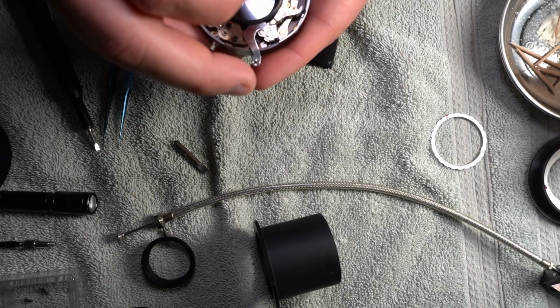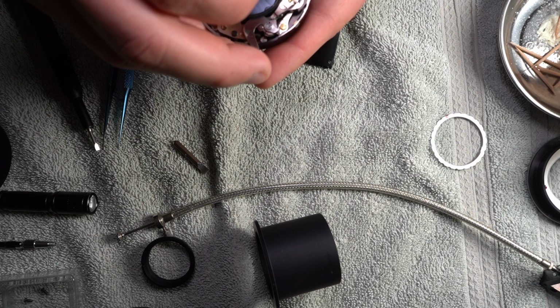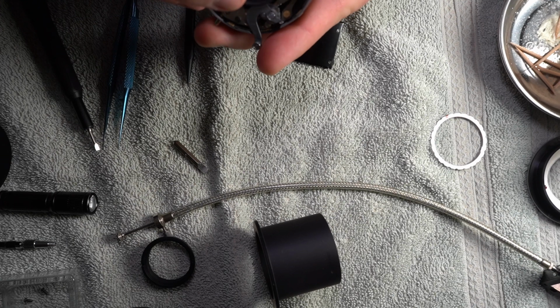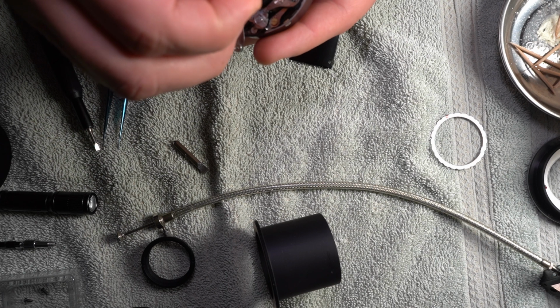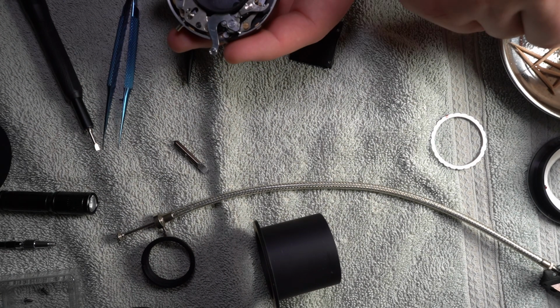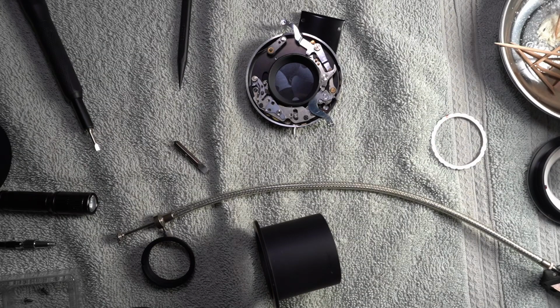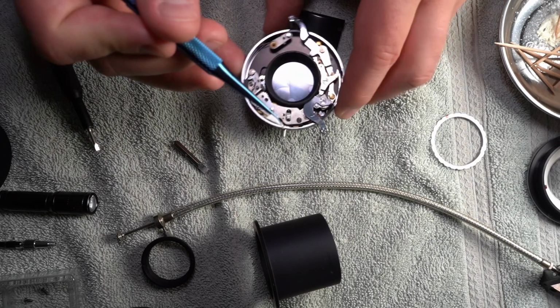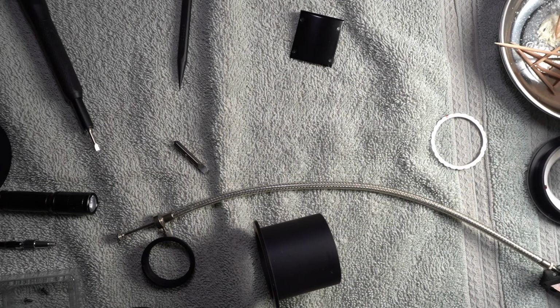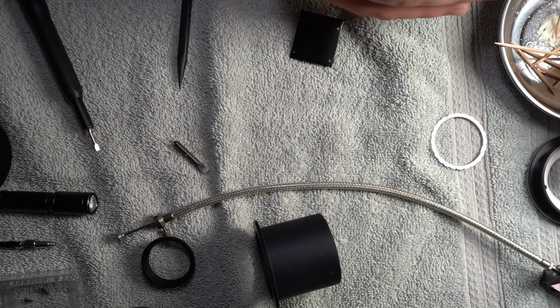And I ought to be doing it someplace else altogether, and I do realize I just took this out of focus totally, but sorry. Can't help that. There's actually quite a bit of, I don't know if it's old grease, quite a bit of black stuff that's coming off of these things when I'm applying this grease. So I'm kind of trying to keep my impact down on it. And you can maybe see that on there. I don't know. Probably not.